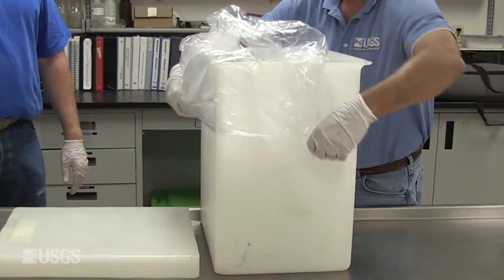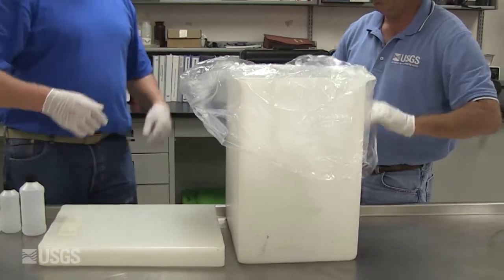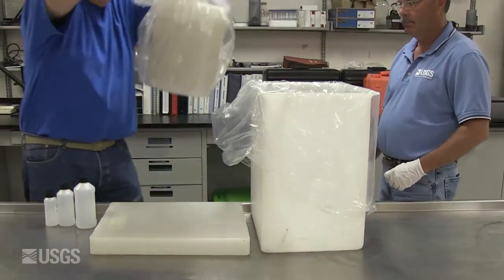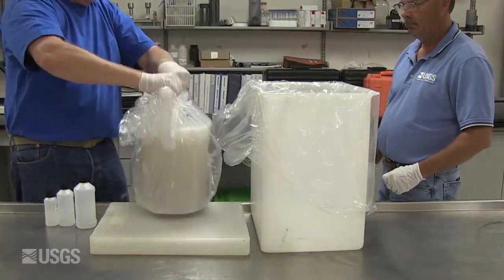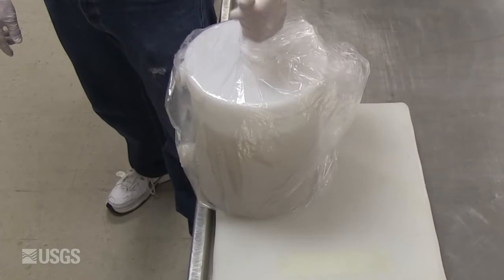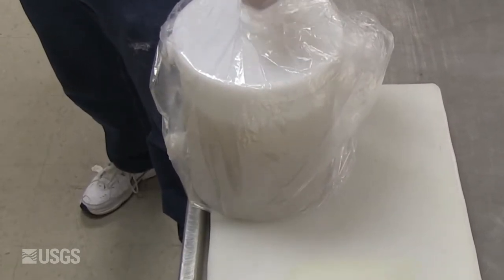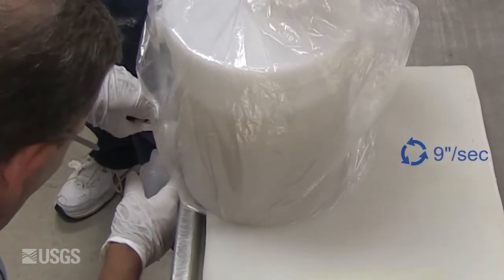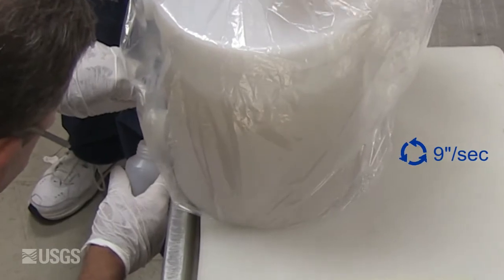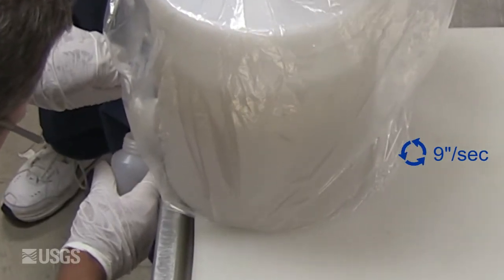While wearing disposable gloves, remove the churn splitter and inner bag from the churn carrier and place it on a level surface. The Dirty Hands team member churns the splitter throughout the sample processing at a uniform rate of 9 inches per second by raising and lowering the disc inside the churn with smooth, even strokes.